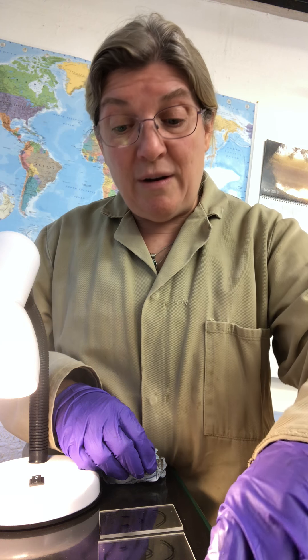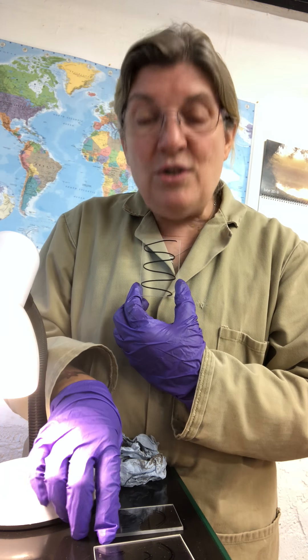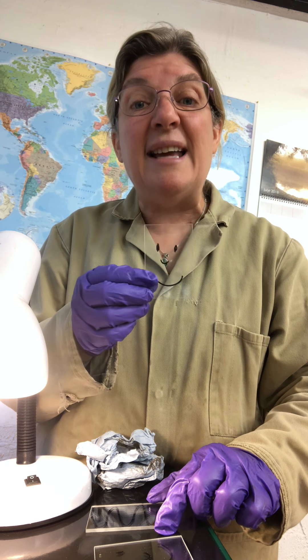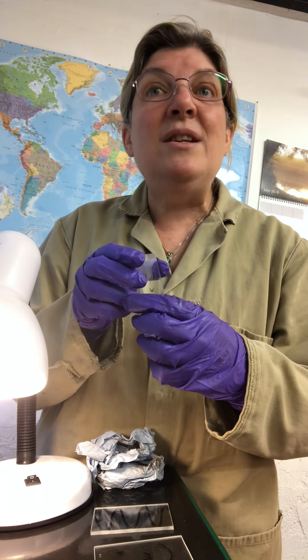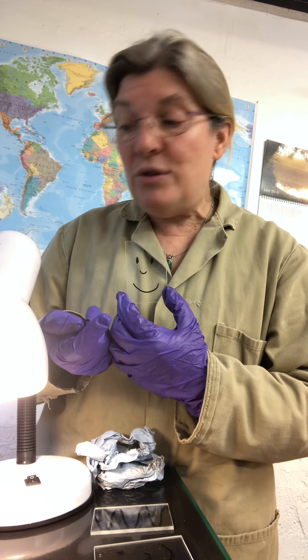Remember we pre-marked our glass with a permanent marker. I used to let students have a bit of fun with this — you could draw anything you wanted on the surface of the glass, because what we want to see is those markings ground away. So you can get quite artistic if you want.